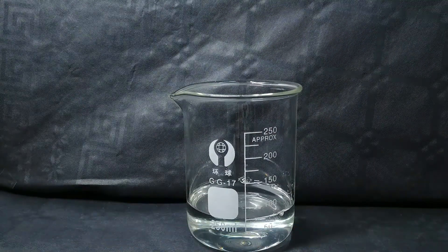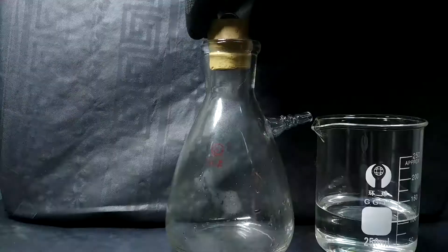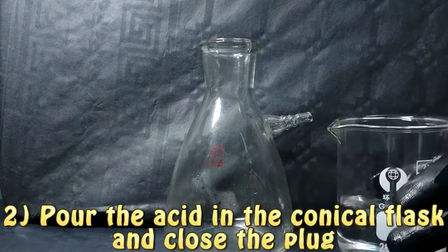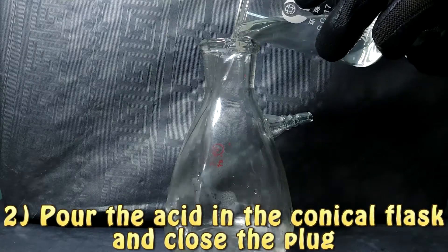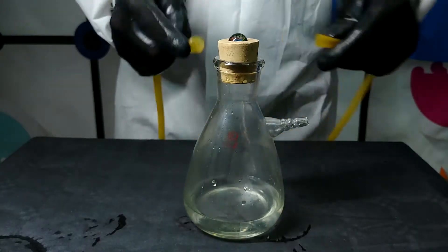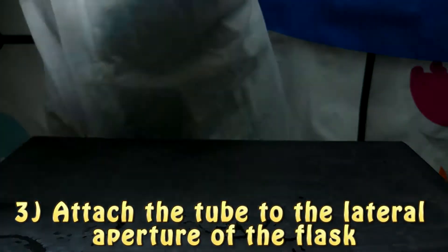We are preparing a solution of hydrochloric acid. In particular we commonly find two kinds: the muriatic acid that is concentrated from 10 to 15 percent and is commonly found in supermarkets, and the hydrochloric acid solution that goes from 30 to 33 percent concentration that is commonly used to lower the pH of swimming pools. The flask also has a sideways-facing aperture which we are going to use to transfer our gas to another recipient.